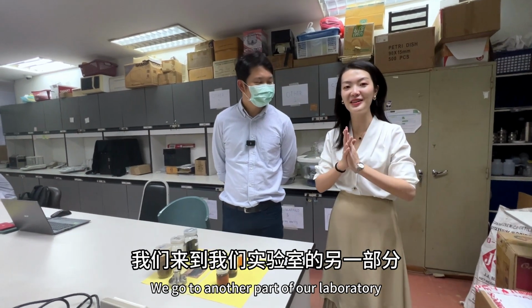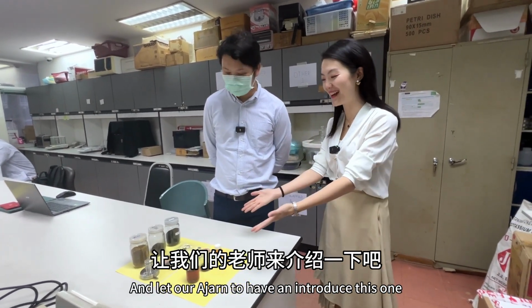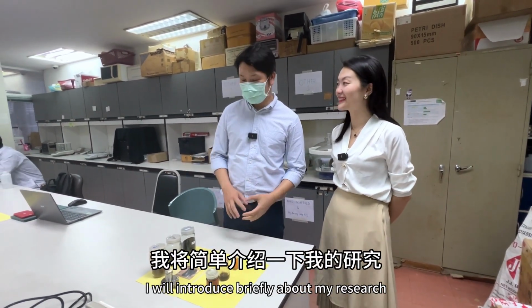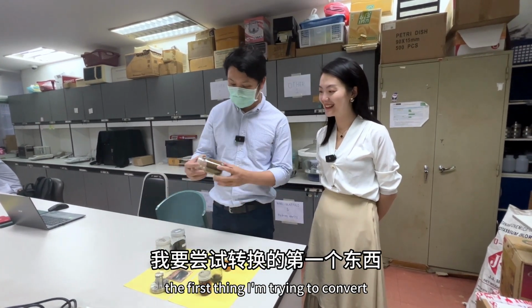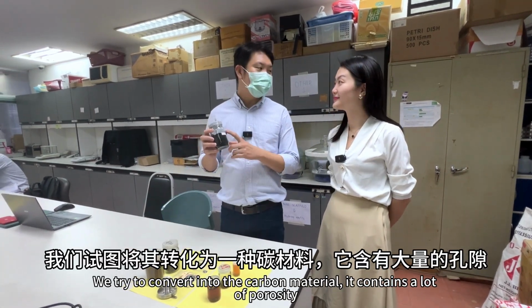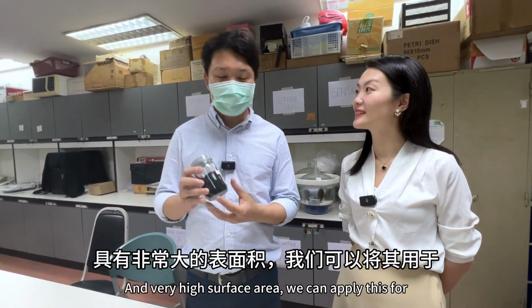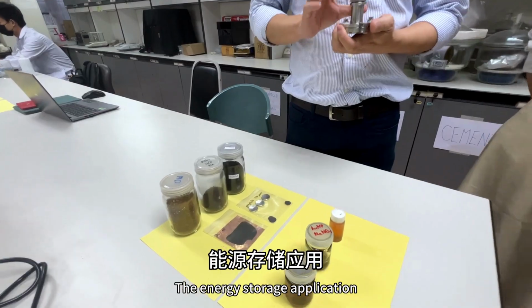Okay, we'll go to another part of our laboratory and let our Ajahn introduce this one. My name is Kasit Panuswan. I will introduce my research briefly. In the first theme, I'm trying to convert biomass, a natural waste in Thailand, into carbon materials. They contain a lot of porosity and very high surface area, and we can apply them for energy storage applications.